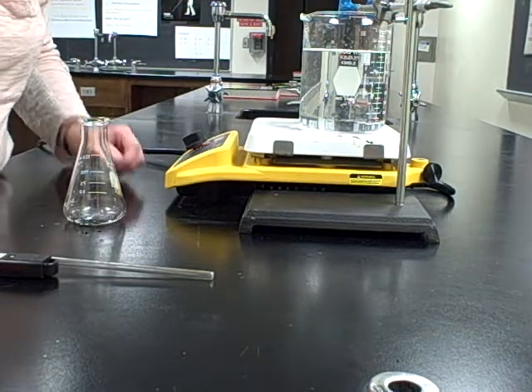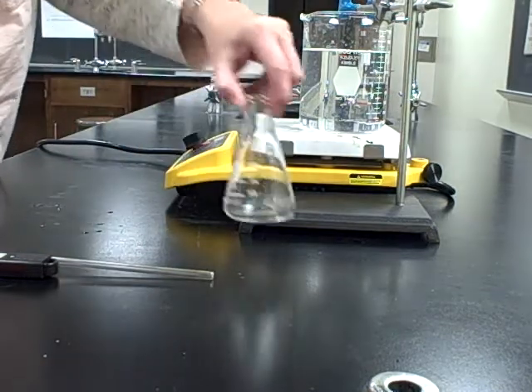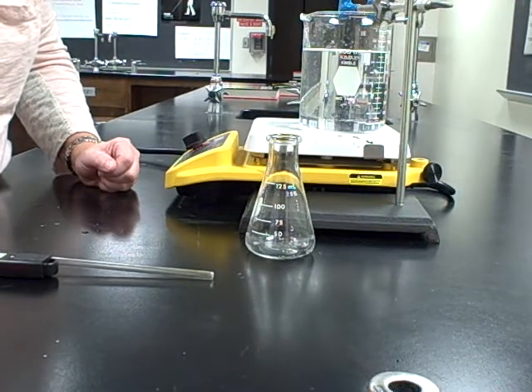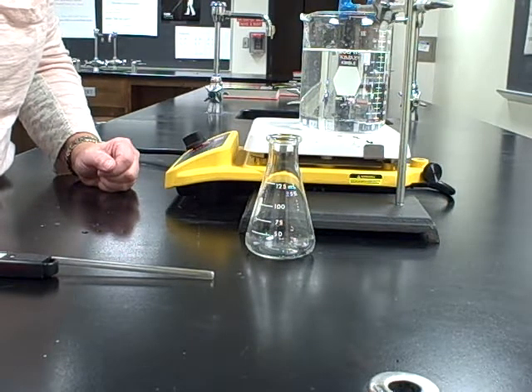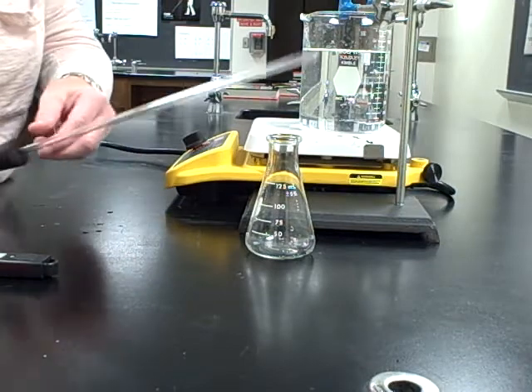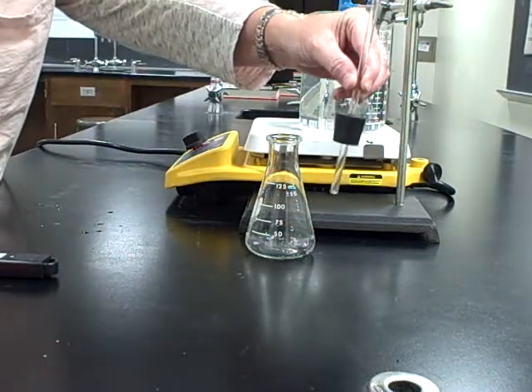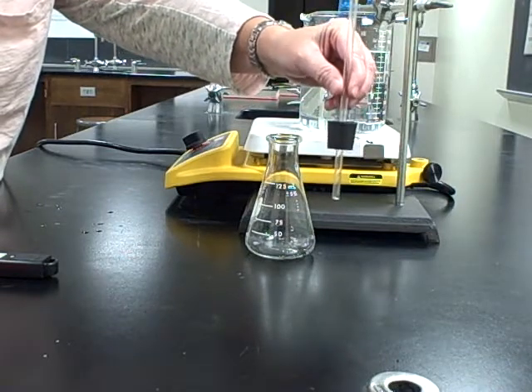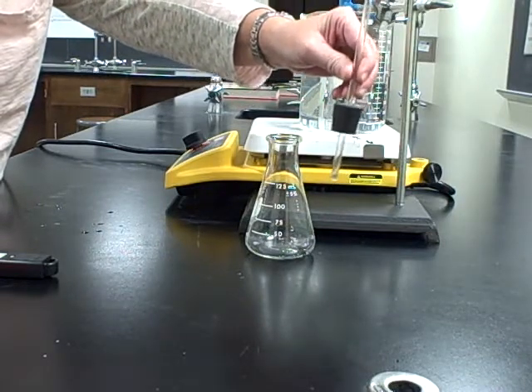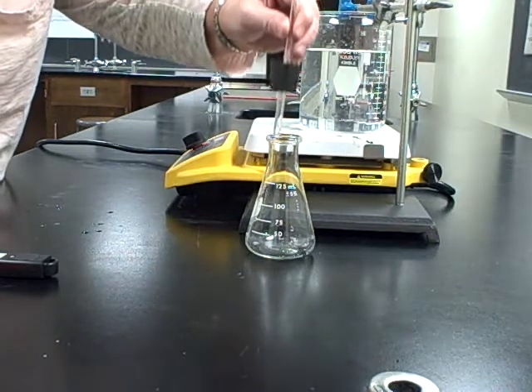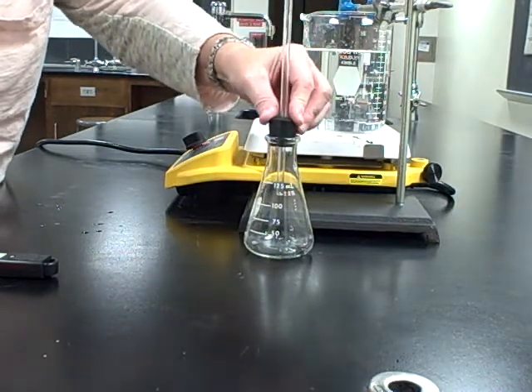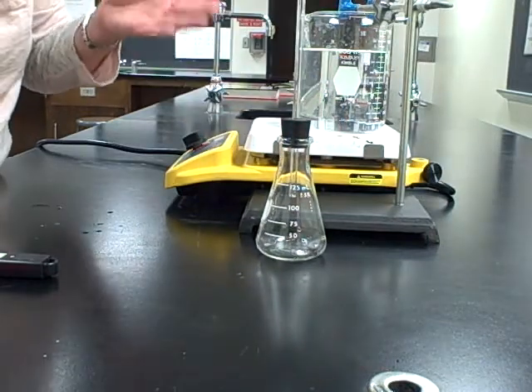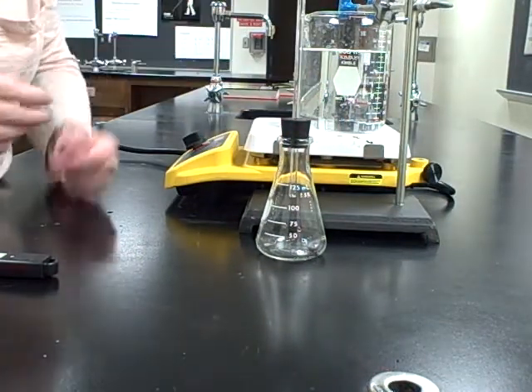Step three says find the mass of the flask. We're using the smaller 125 milliliter flask, and that's just the stopper and eyedropper all together. Instead of the stopper and eyedropper, you've got one piece that looks like this—like having a really long eyedropper. I think it'll be easier to tell when the liquid is done vaporizing. This will fit in there. You're going to go ahead and mass this whole thing together. This is going to be considered our empty flask, even though we know there's some air in there.